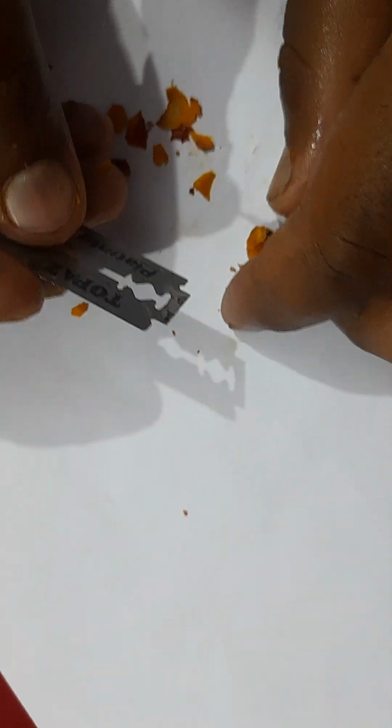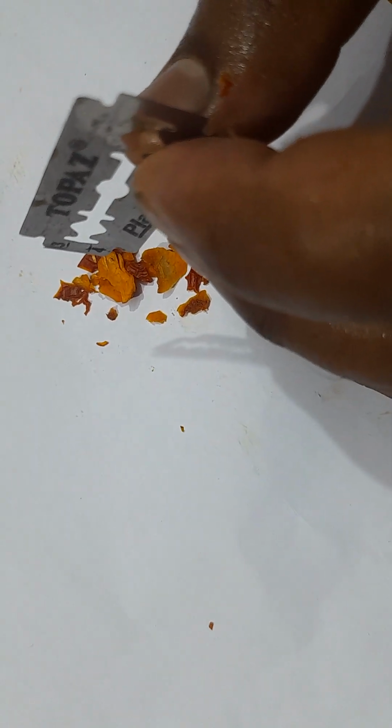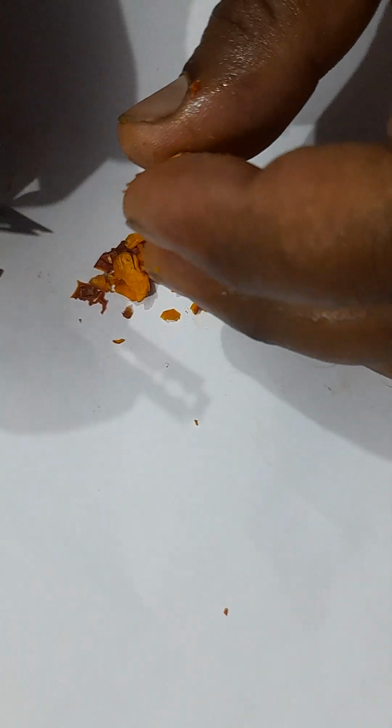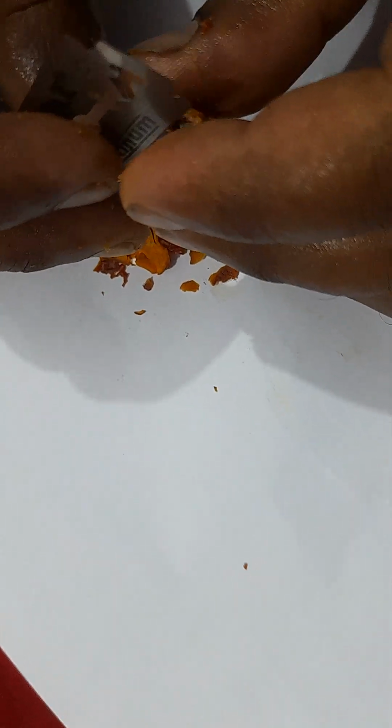how if we cut the ovule of the cycas, the integument, basically the outer covering, is called integument. Integument, that is called in Hindi Adhyavaran, has 3 layers. Outer is fleshy, this is the fleshy outer coat, you have removed it. This is the stony, that is the light yellow color, and the inner fleshy layer is fused with the female gametophyte. Okay, and you will see it as a dry membranous covering.